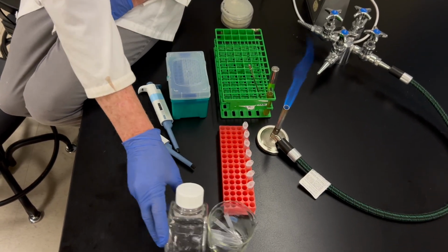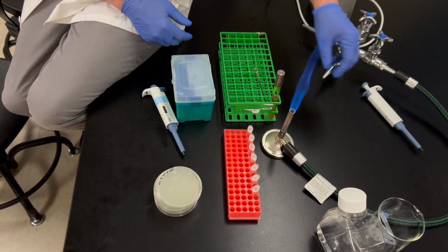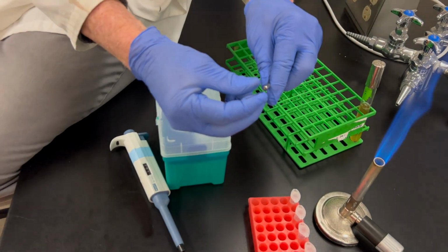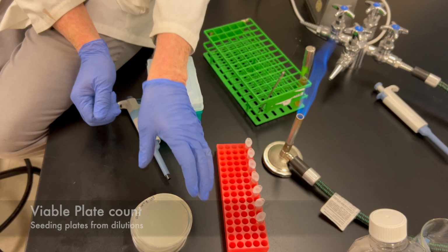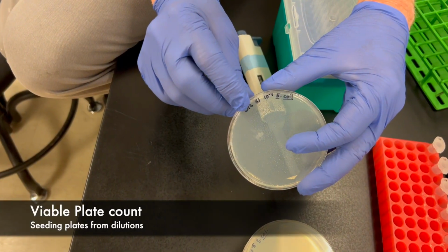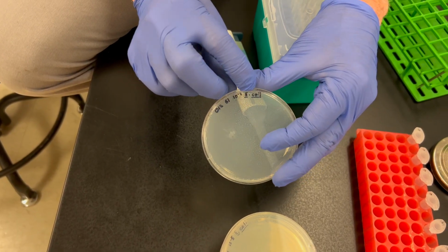All right, let's move a couple things out of the way here, and I'm going to put in some plates. We'll remove this, and we'll keep my loop right here. I'm going to straighten my loop in preparation for the next step. The next step is to take these plates, and you see these plates have already been labeled. This plate is labeled for the section number, the group number. It is 10 to the negative 4, and it is E. coli.